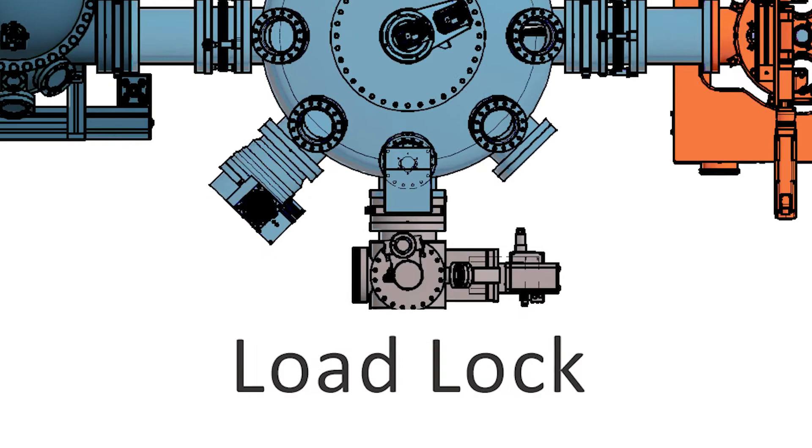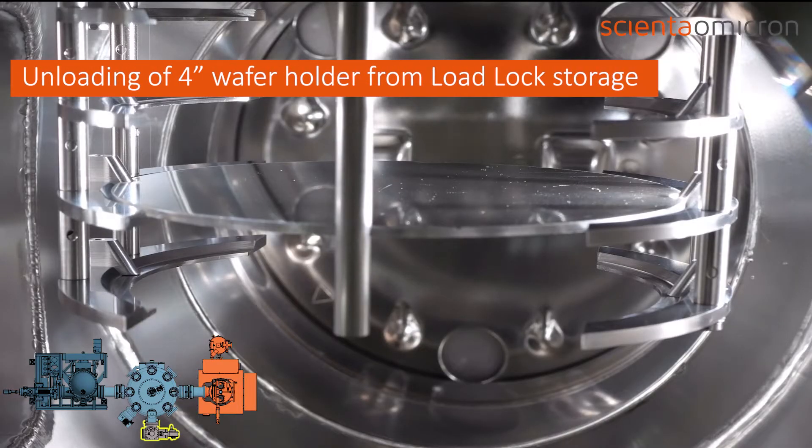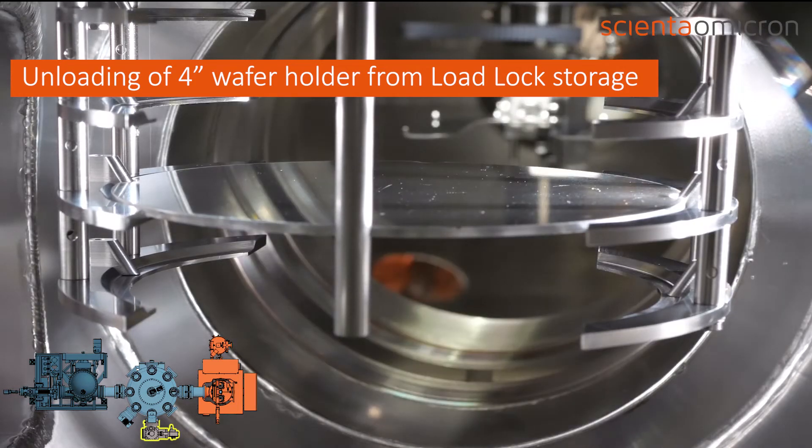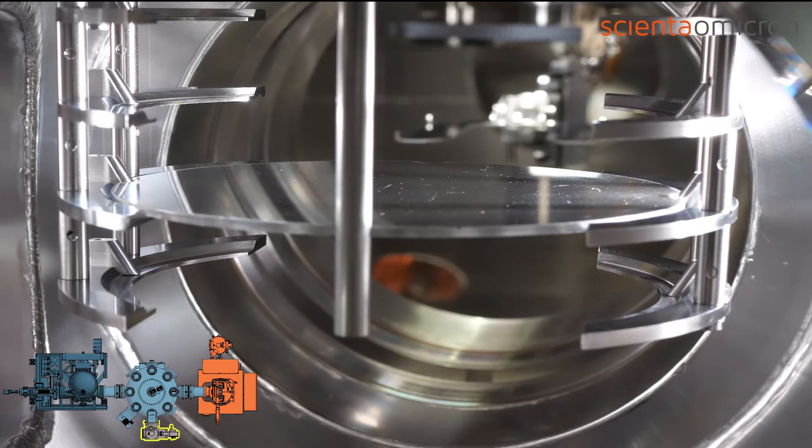The sample transfer typically starts in the load lock chamber. Here up to four wafer holders with 4-inch size can be mounted in the storage. After establishing a suitable vacuum in the chamber, the transfer can be initiated.